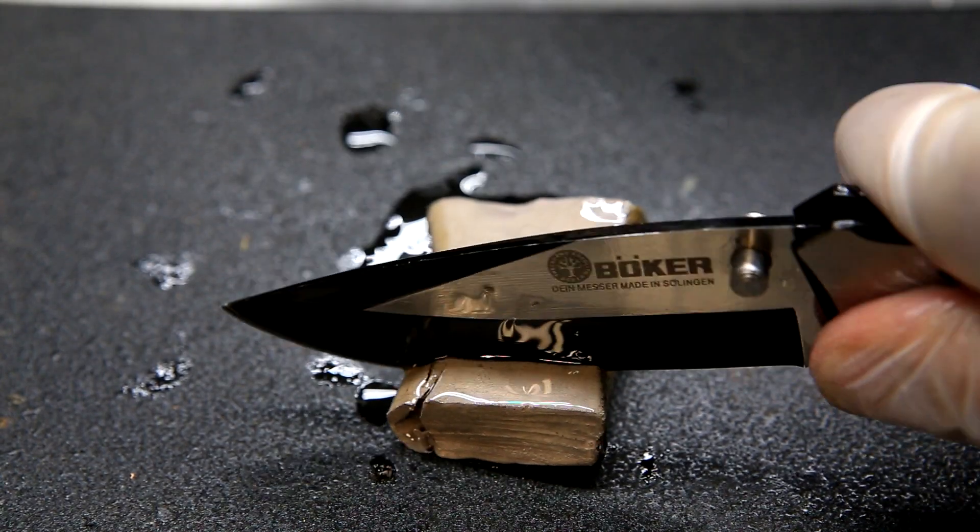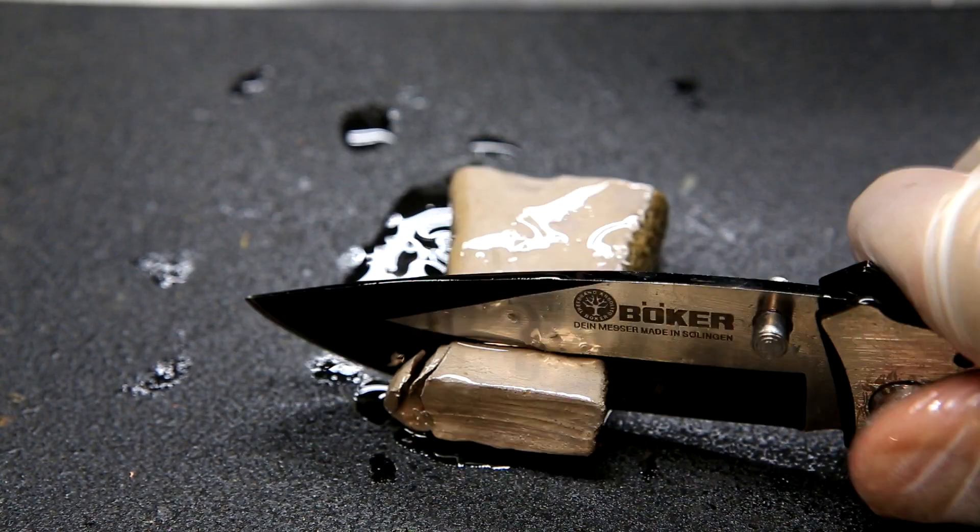As I said before, the sodium is quite soft, and you can see here that it's easily cut using a knife.